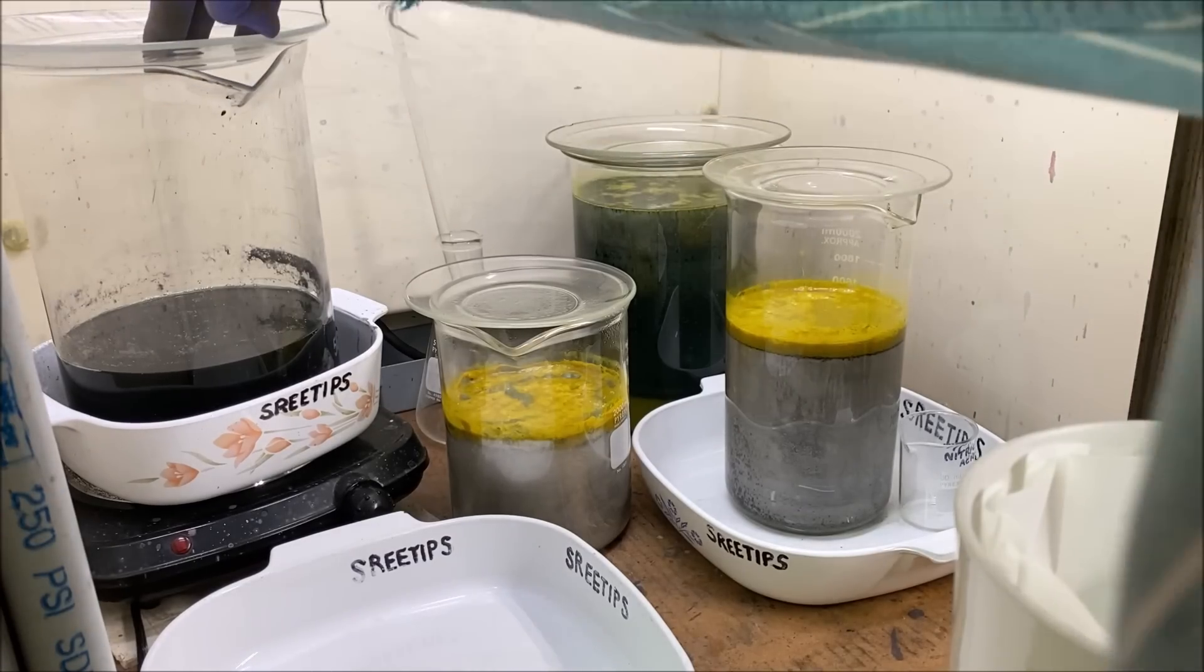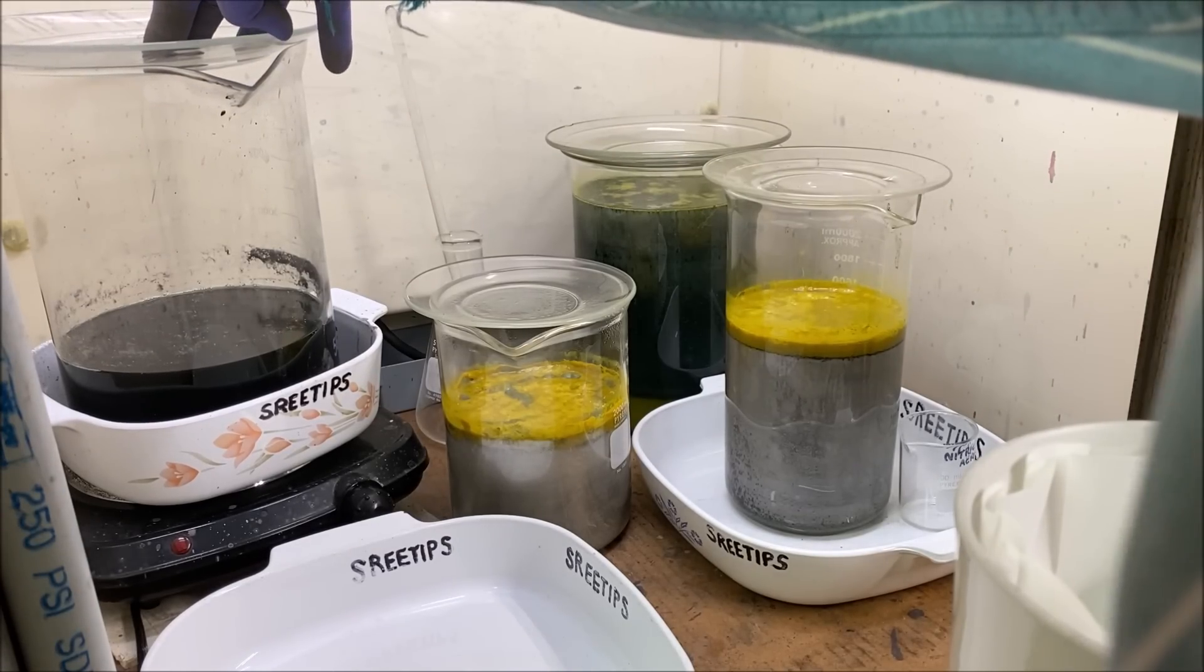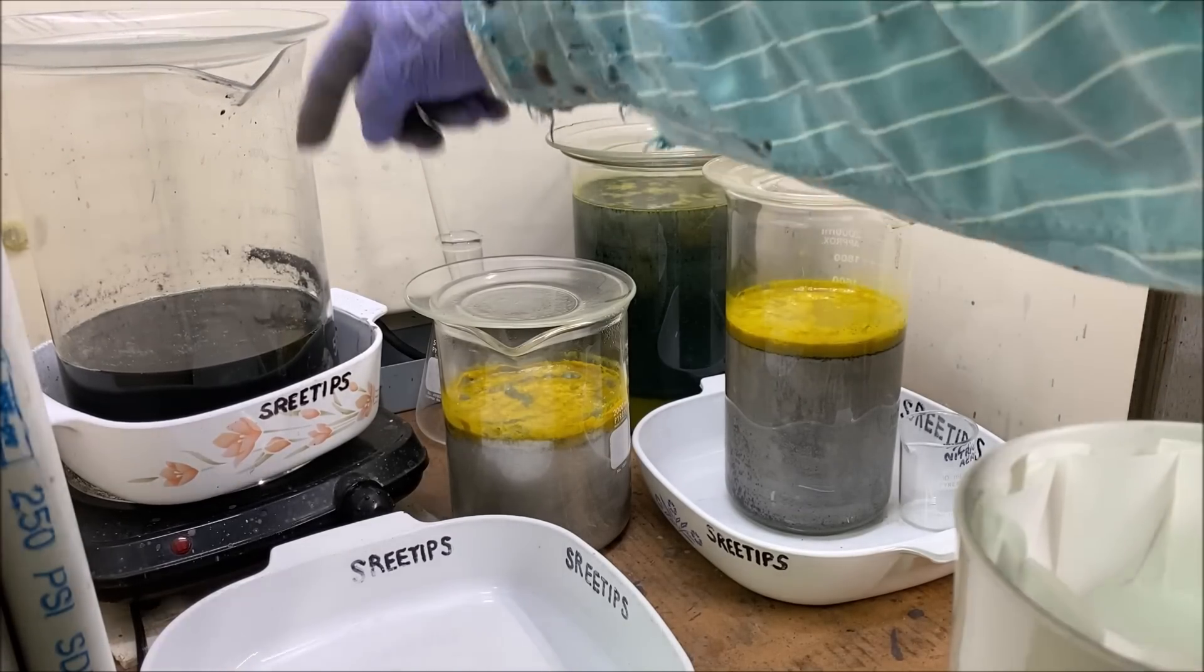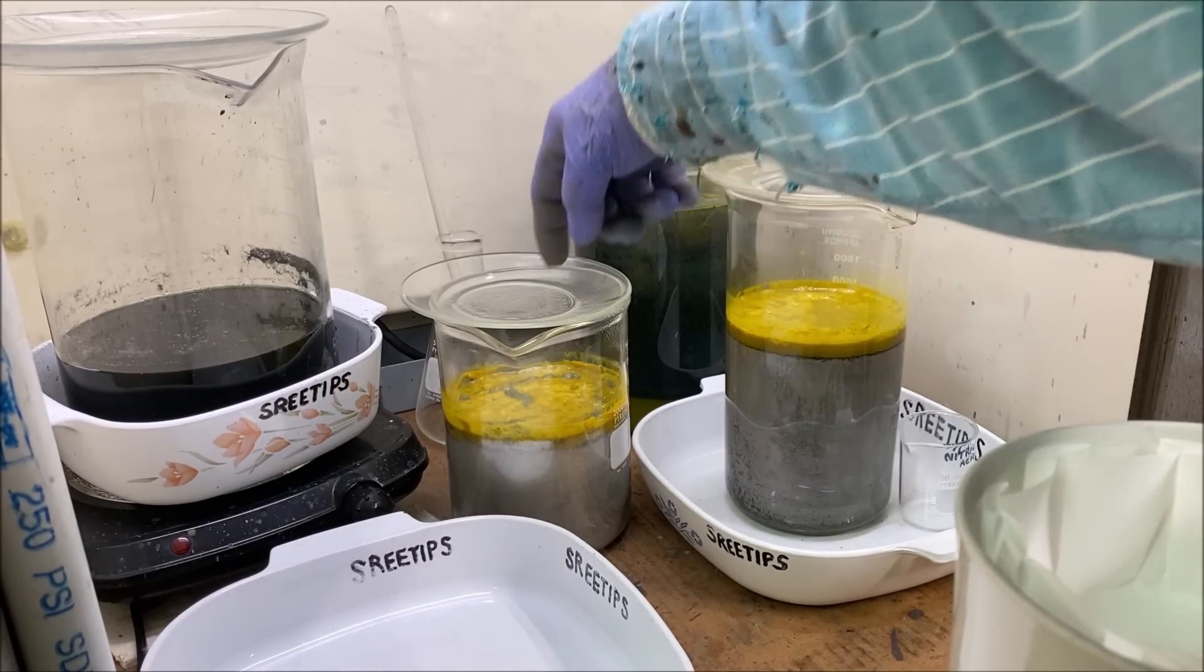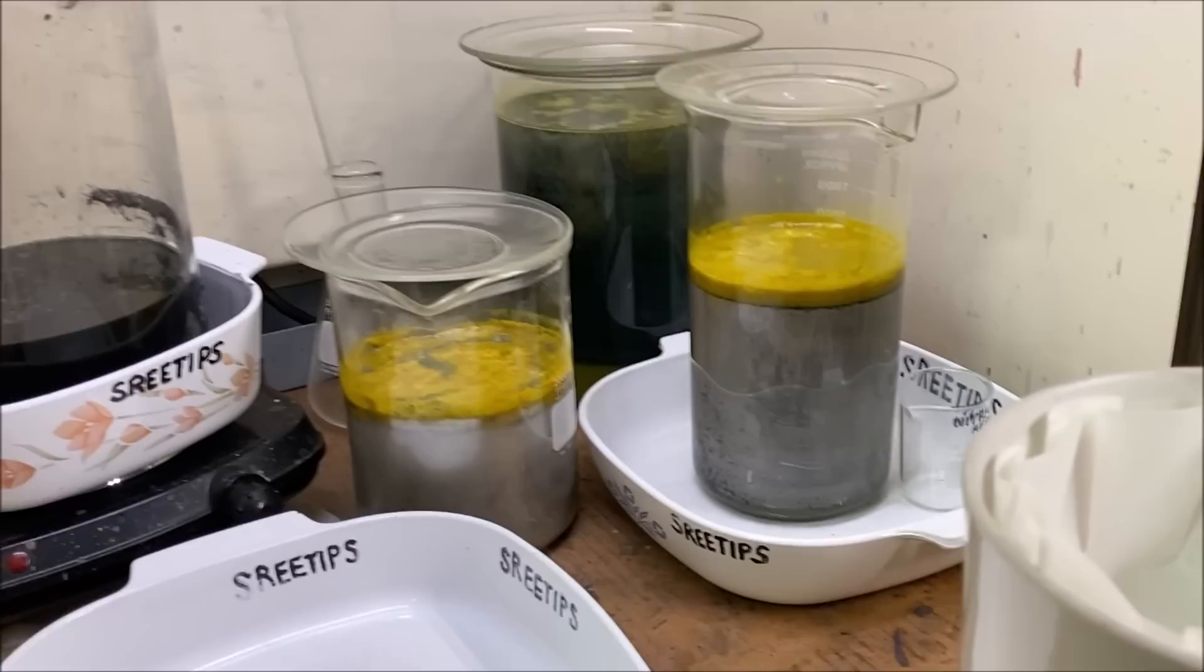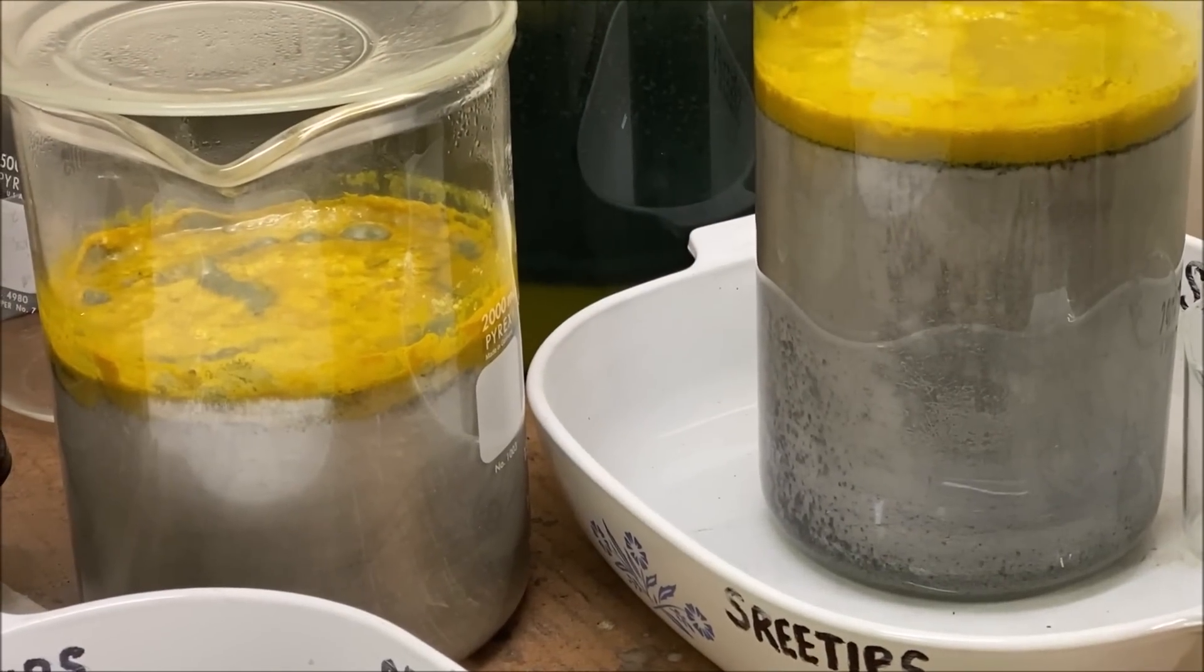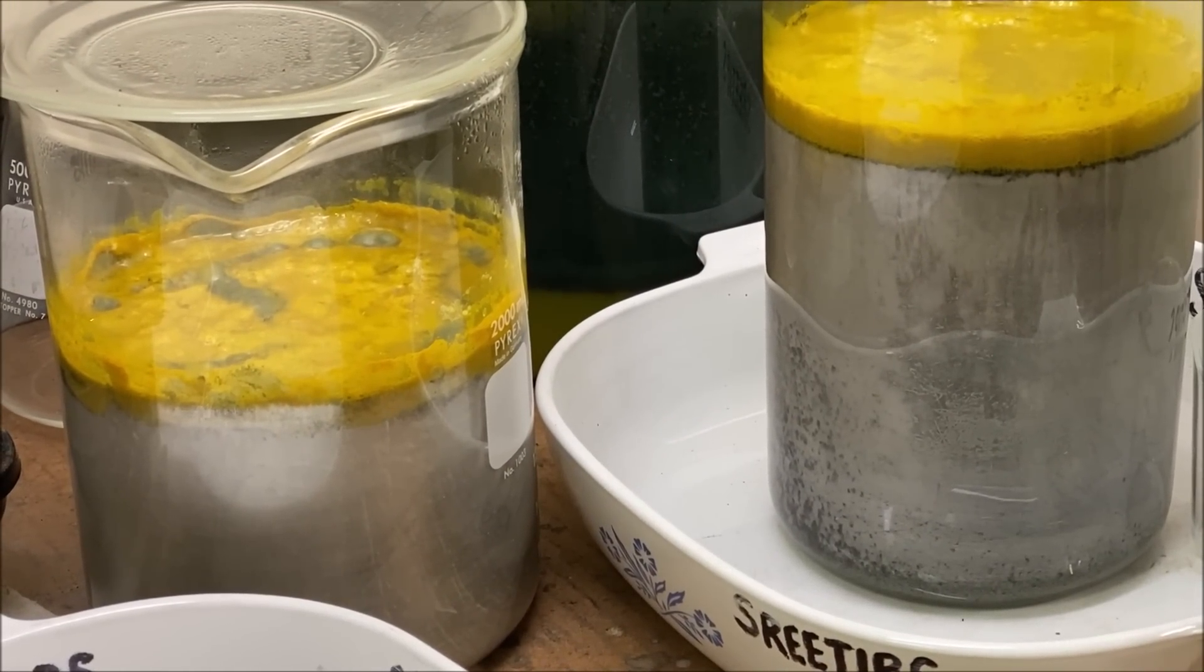I've allowed this to cool and settle overnight, so now what we're going to do is filter off the liquid and get the solids out of here. If you look down here, both these beakers have silver that has come out of solution and that's going to present a problem.